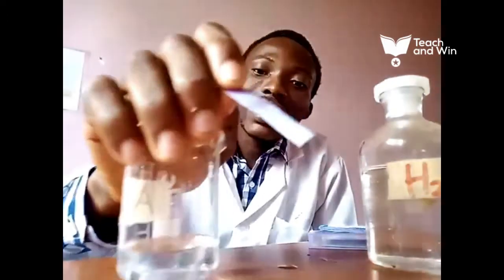So here we go — you pour a little quantity of the acid into a beaker, just a little. And then the litmus paper, you are going to dip it inside the acid.